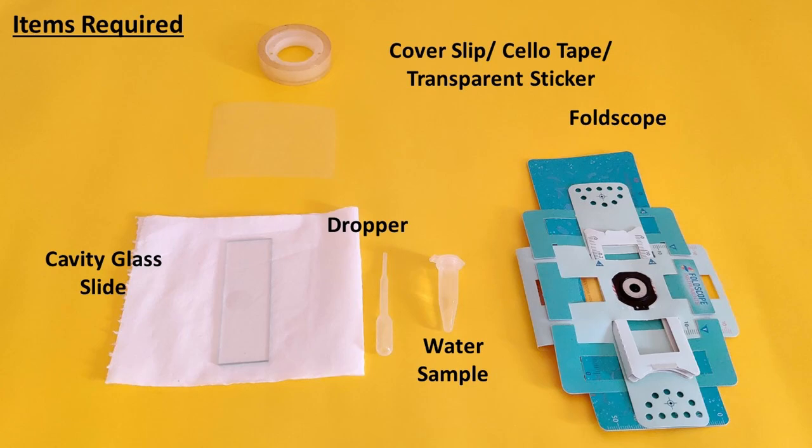We are using stagnant rainwater today. You can use water from any other source such as tap water or water from a lake, a pond, or a well.